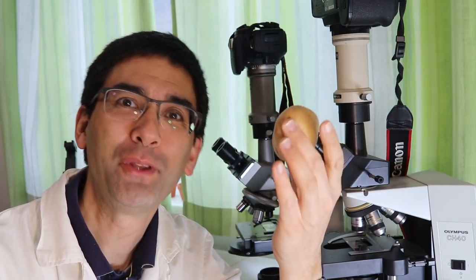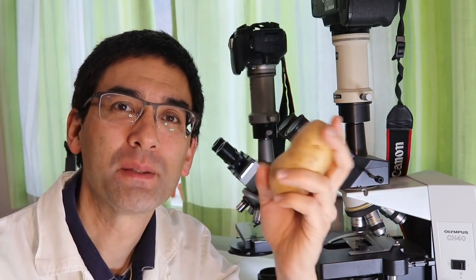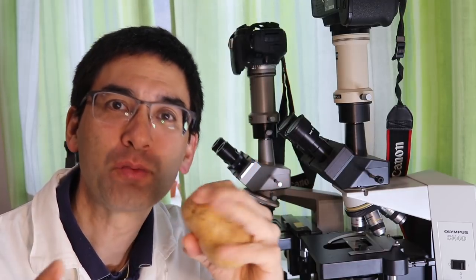So hello and welcome again, Microbe Hunter here. This is a potato of course and what I want to do today is I want to look at some potato starch grains under polarized light. It's a very straightforward and simple investigation and I think you're gonna enjoy it. It looks pretty nice.